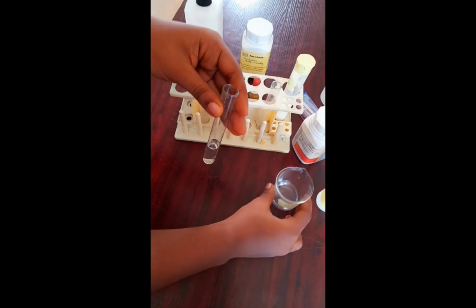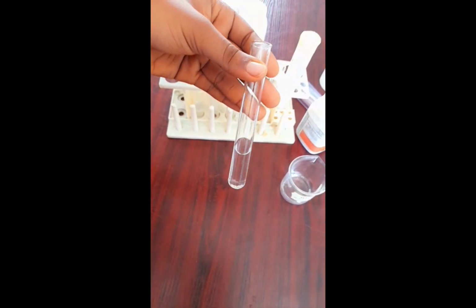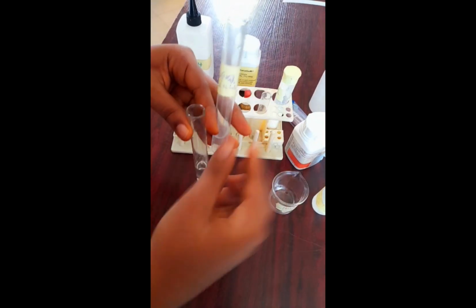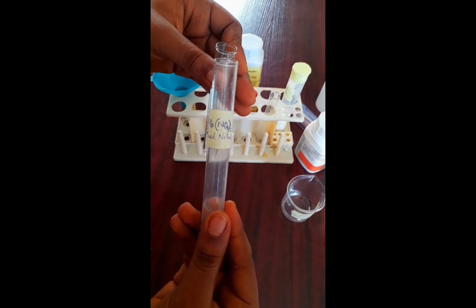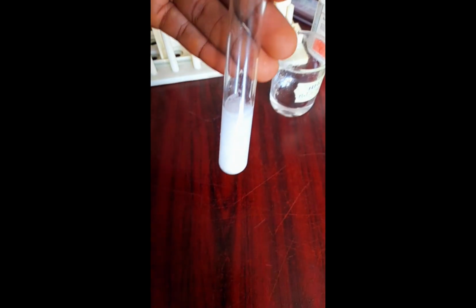And then we see there's no visible reaction. You look at it, you see it's a clear solution, nothing happened. Now we are then asked to add silver nitrate, but I didn't have silver nitrate, so I'm using lead nitrate. Using lead nitrate here, it's still going to form, this time, lead chloride. So as we add it, you see a white precipitate is formed.